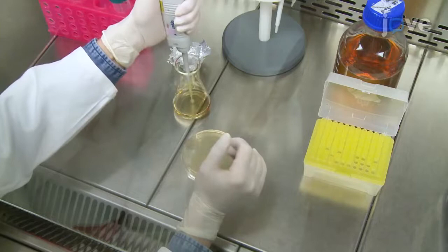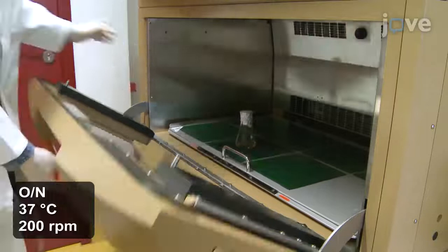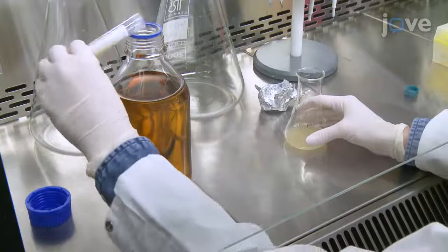The next day, add 10 mL of overnight culture to 1 liter of sterile fresh medium. Mix and split the culture into two 500 mL cultures, each in a 2 liter Erlenmeyer flask, and incubate at 37 degrees Celsius and 200 RPM.